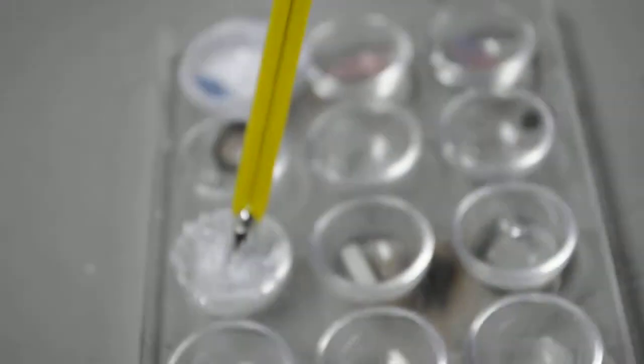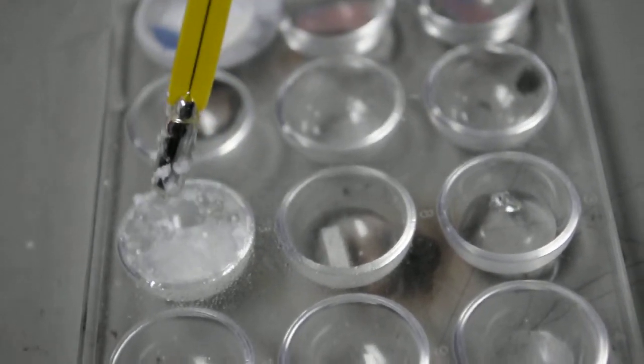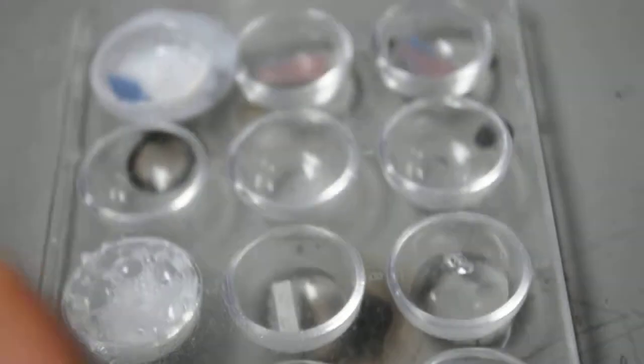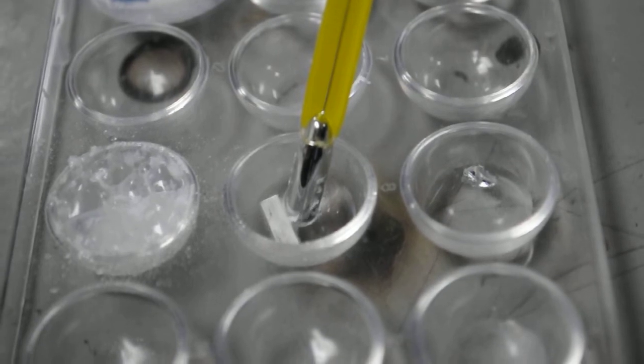Okay, so that calcium is hot stuff, huh? Yeah. Now check out your magnesium water. Wipe off the end of your thermometer. That one. Very good. Okay, now go ahead, put it in there.